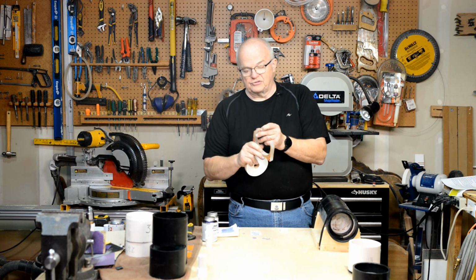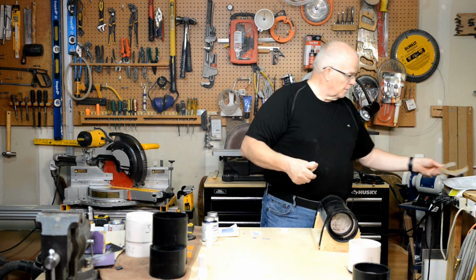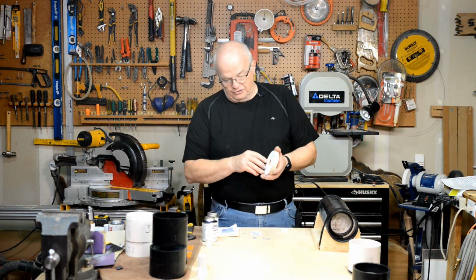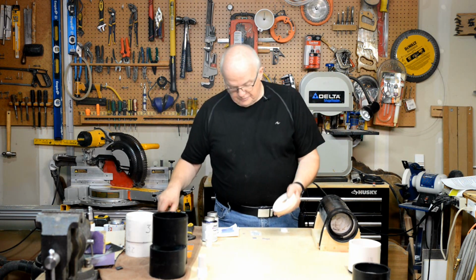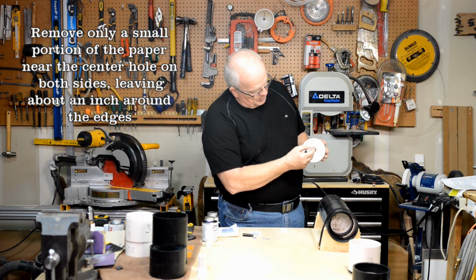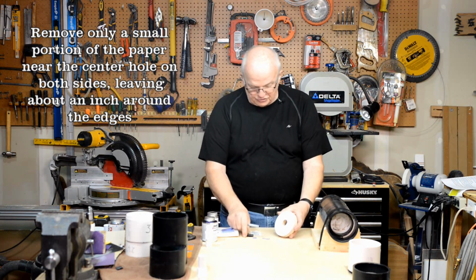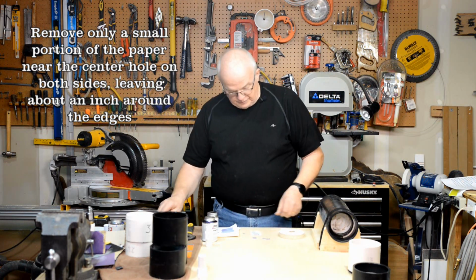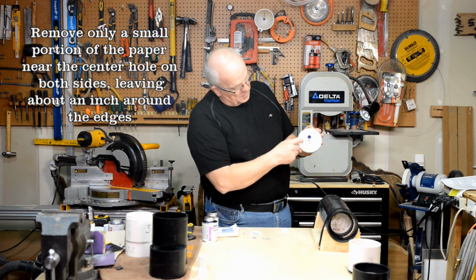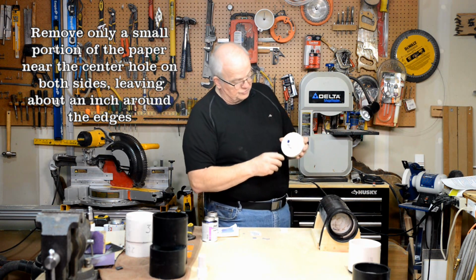Hopefully, that paper is still there. You shouldn't take that paper off. You can see I'm peeling it off here, but you shouldn't take that off until you're completely done with this. So what I want you to do is take some of that paper off right now, maybe about that much. It doesn't have to be pretty, but you do have to expose enough to be wider than this insert right here, okay?